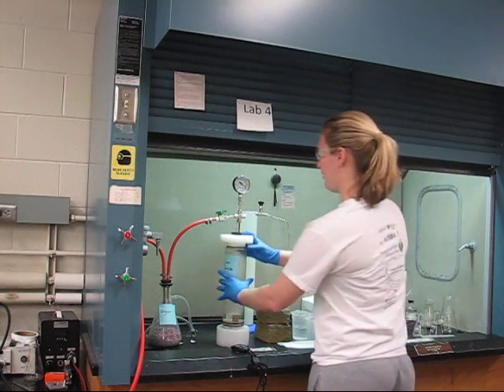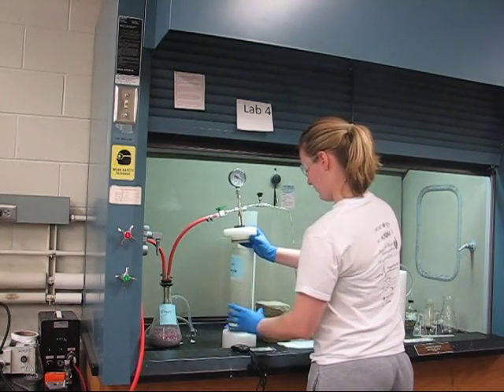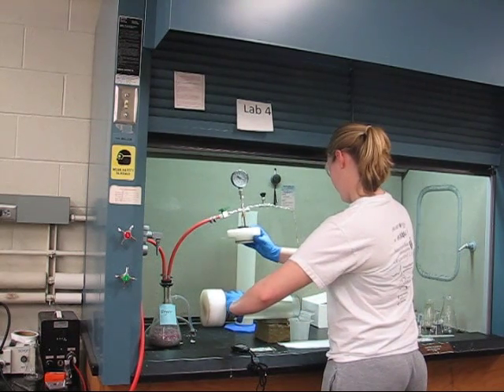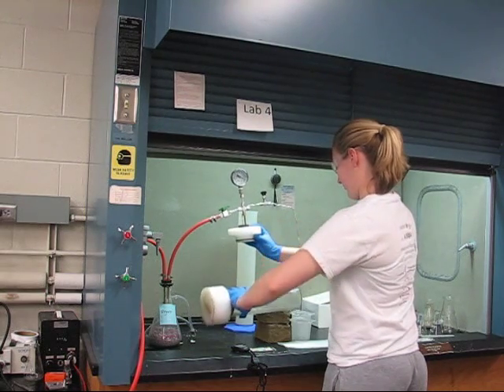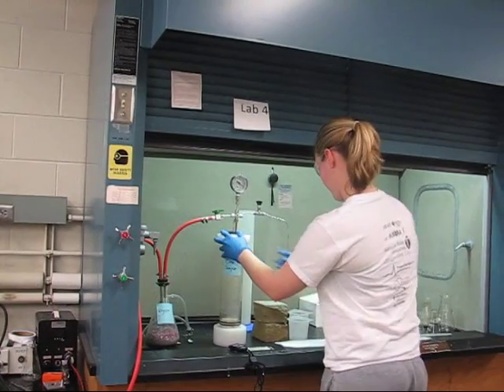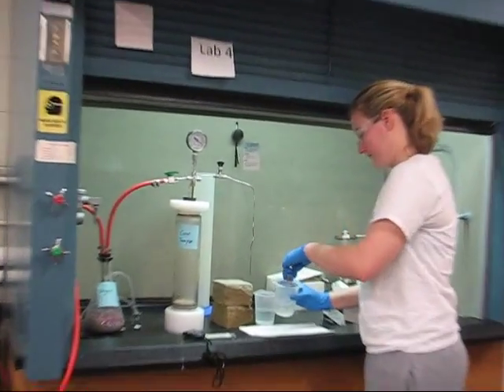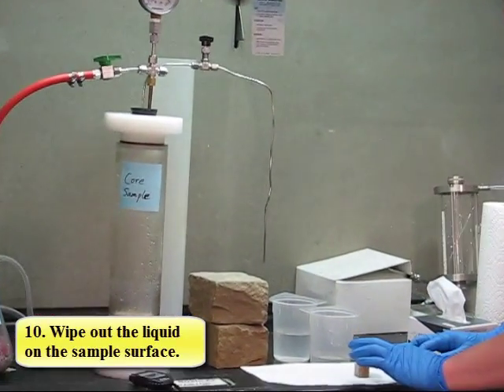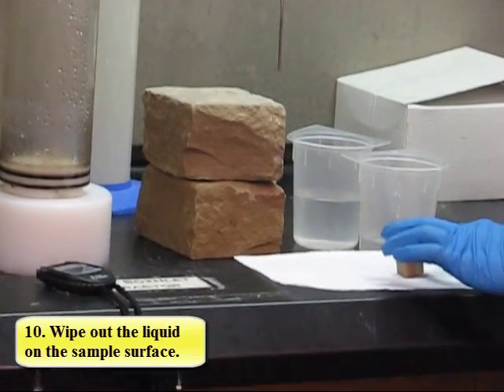Now we're going to gently take out the core sample. Place it on the paper towel and gently roll it until all of the liquid is off of the surface.